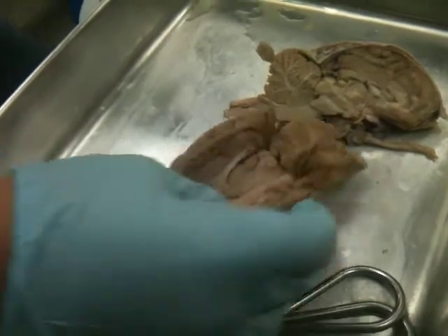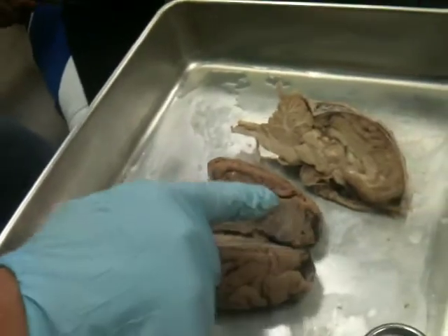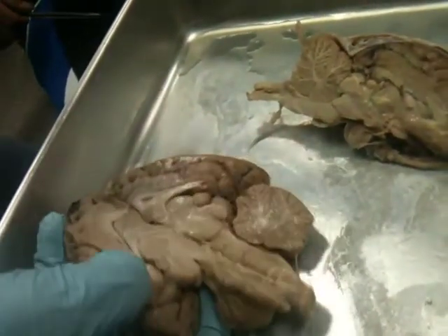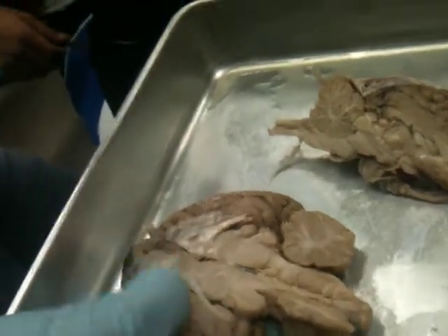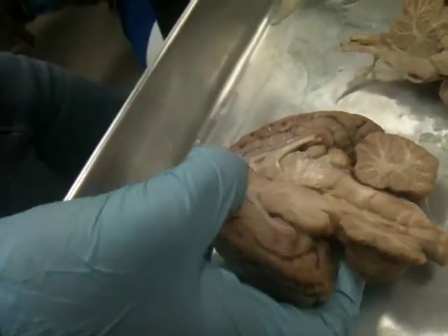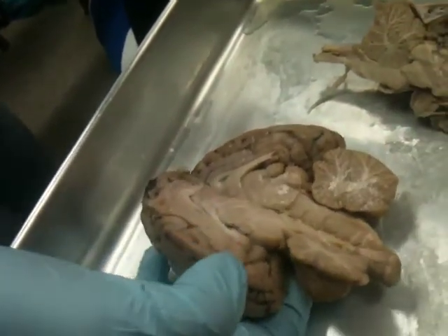Yeah. Okay. And then underneath the cerebral cortex, you can see there's a smooth area, right? So what do you think that's called? That smooth area underneath the cerebral cortex. Where is it? Which one? See how it gets smooth? Right, you stop having the sulci. Corpus callosum? Corpus callosum. Oh, okay. Yeah, so that's pretty much the end of the cerebral cortex.